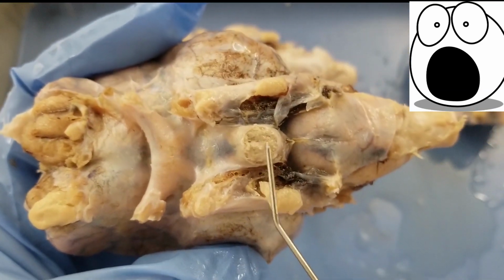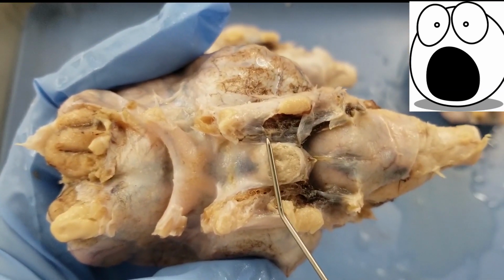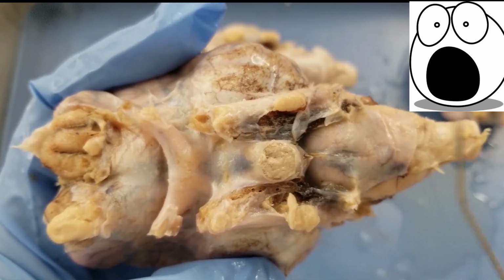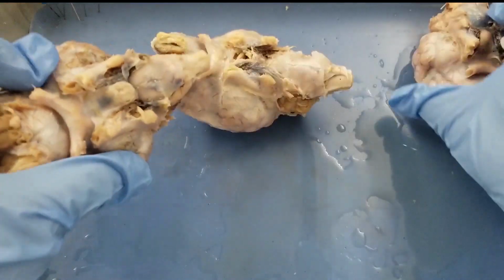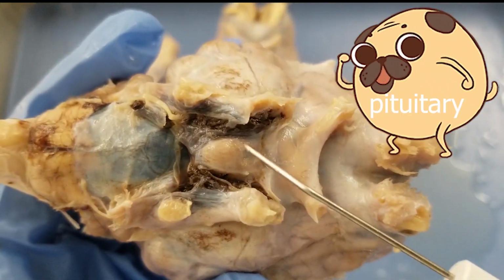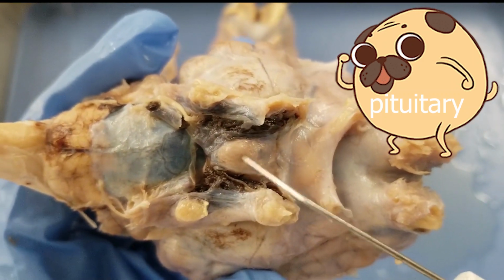And this one also has a tumor-like structure, but some of the tissue got cut, so it's not as shiny as the other one. So what is that structure? That is the pituitary. Okay, that's not a tumor, that's a pituitary. So this guy here, that's a pituitary.